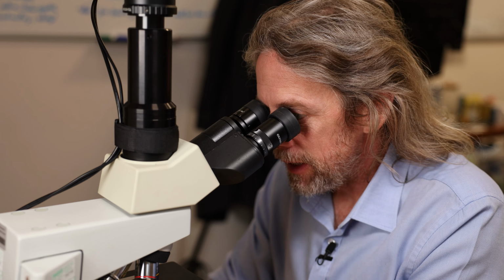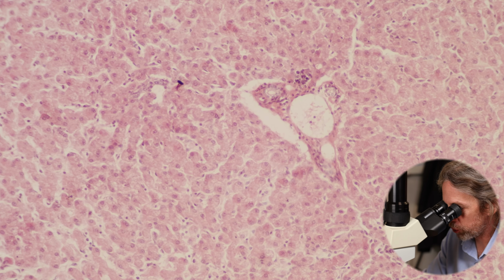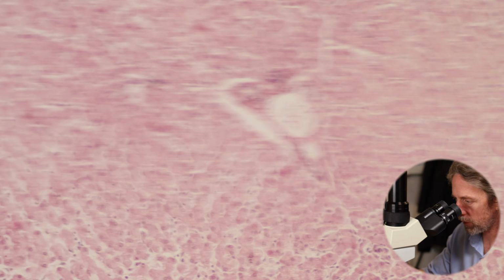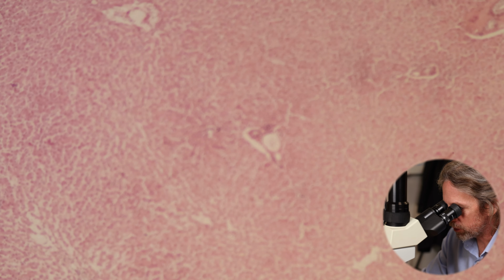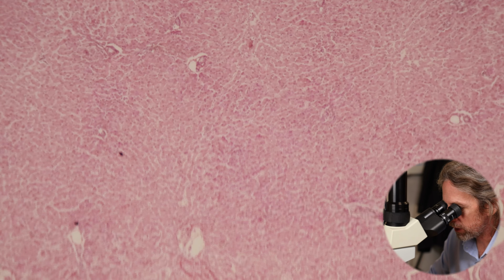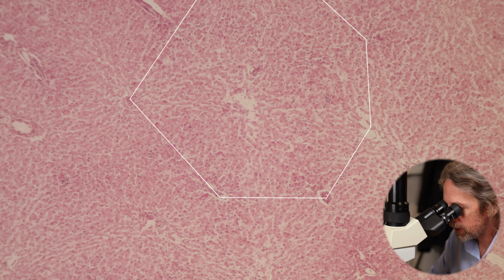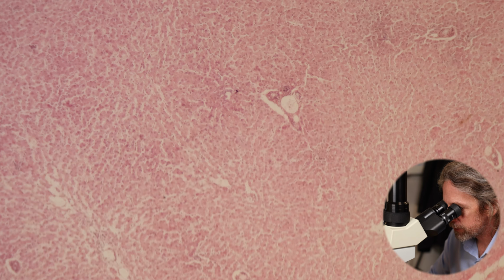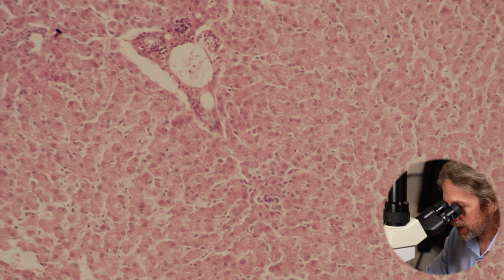Okay, let me walk you through the parts, the things that we can see, and then I'll join it all together to talk about lobules and what have you. There's the wider view of this tissue. So we've got a sea of hepatocytes with lots of circles. Those are tubes, input and output tubes. If you look at that, can you imagine any shape or structure in there? Everything is arranged. Right, okay, that's quite nice there. This will be our portal triad. This is where we have 2 inputs and 1 output.